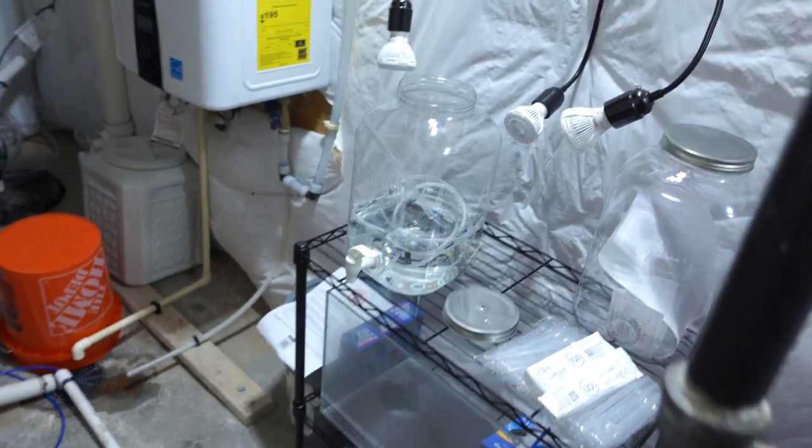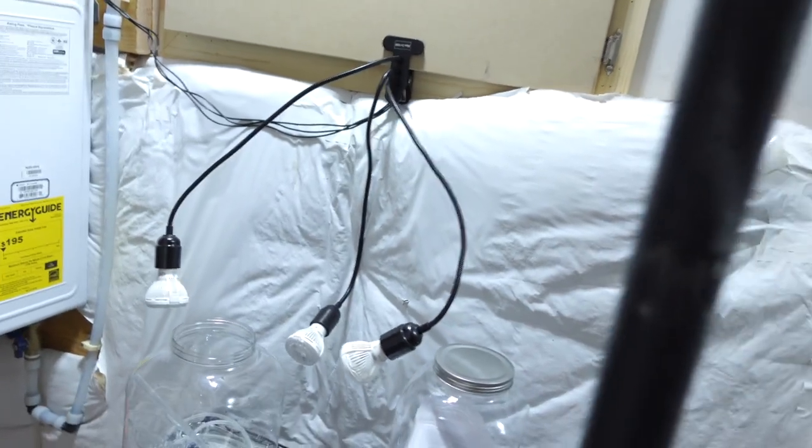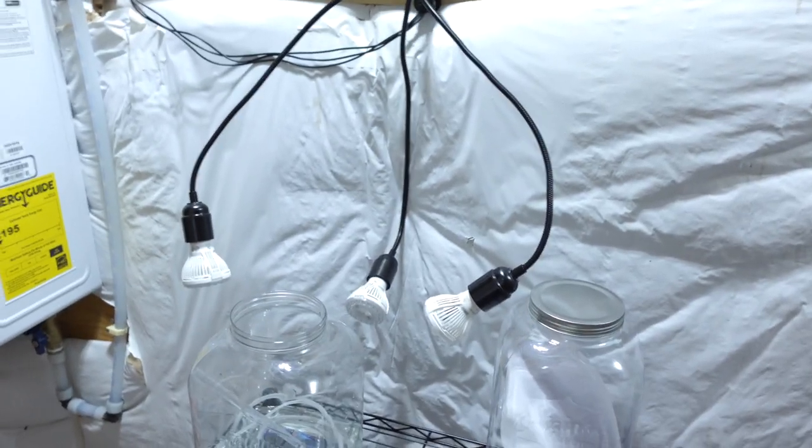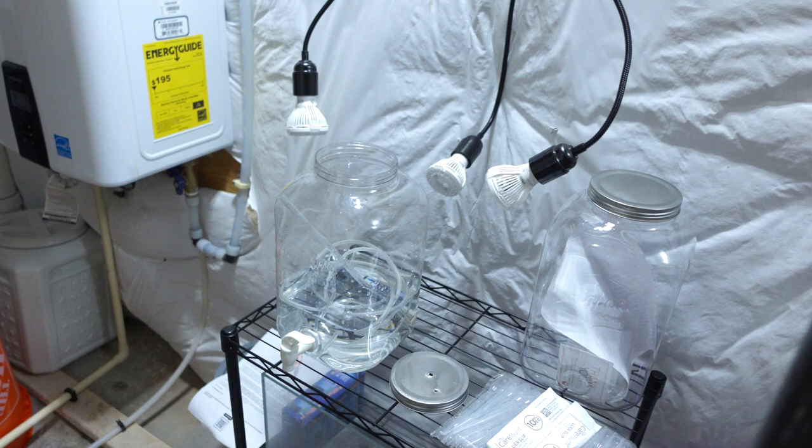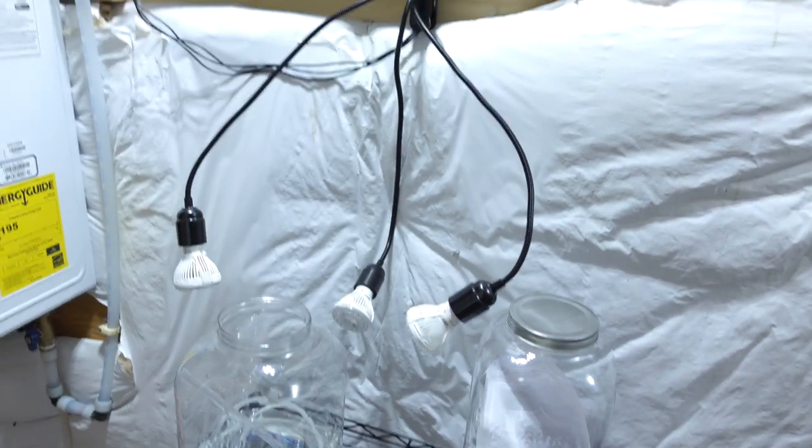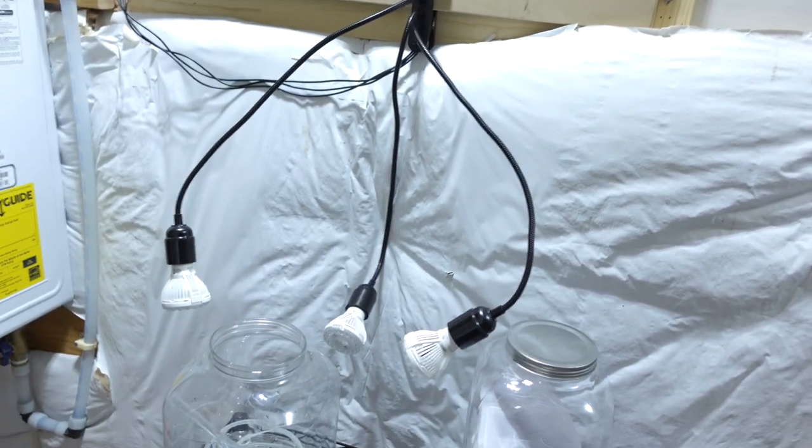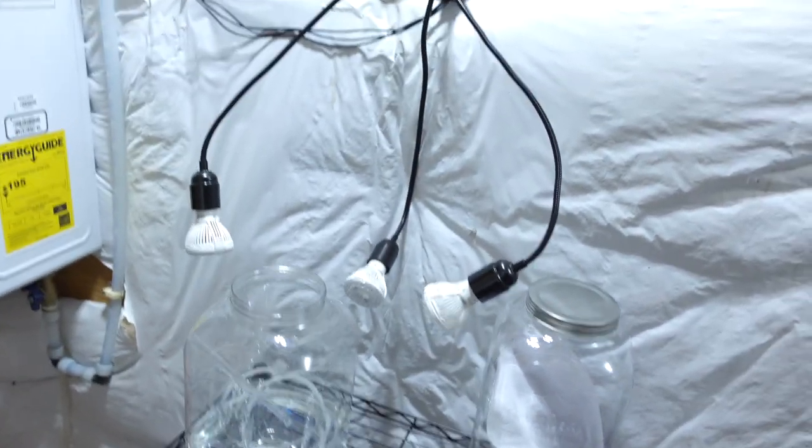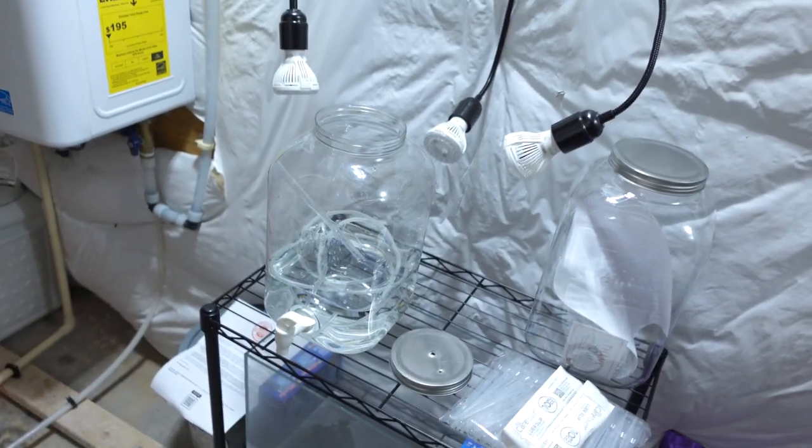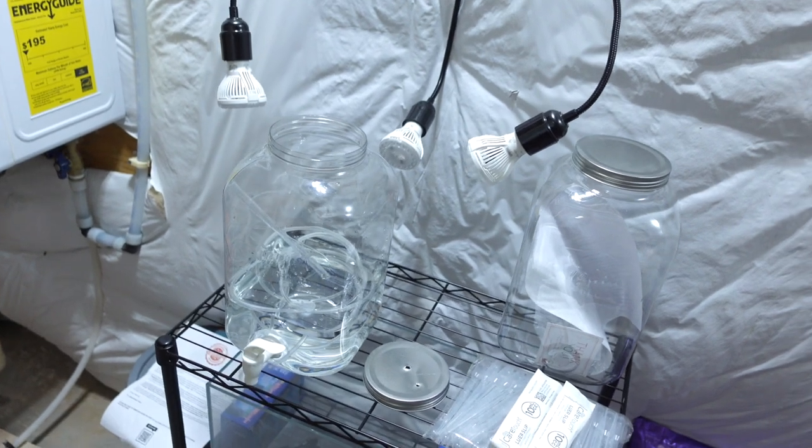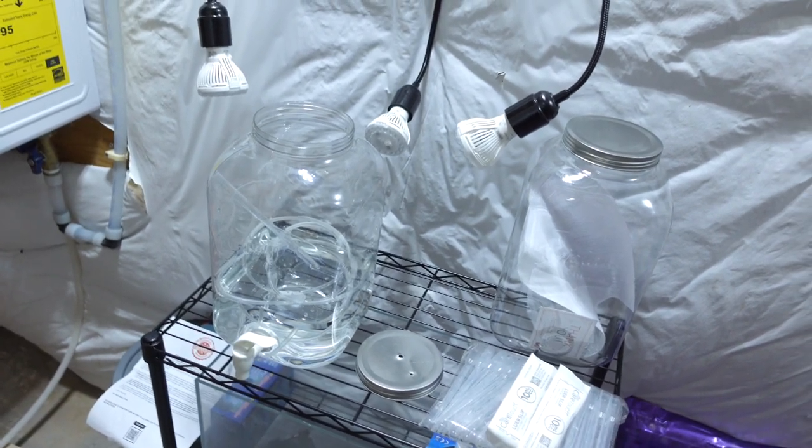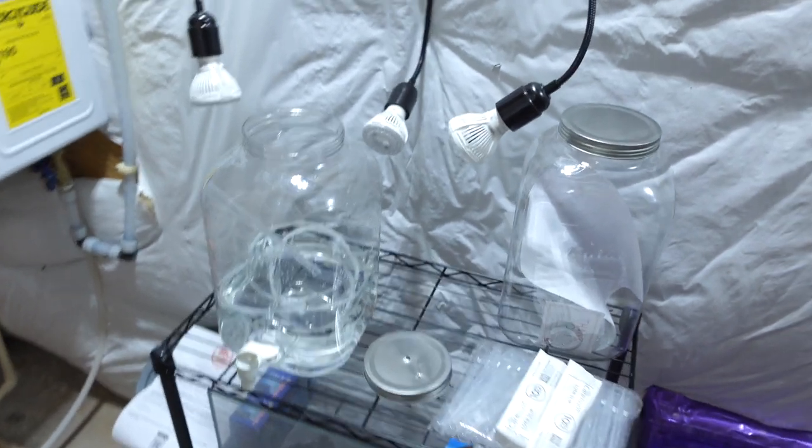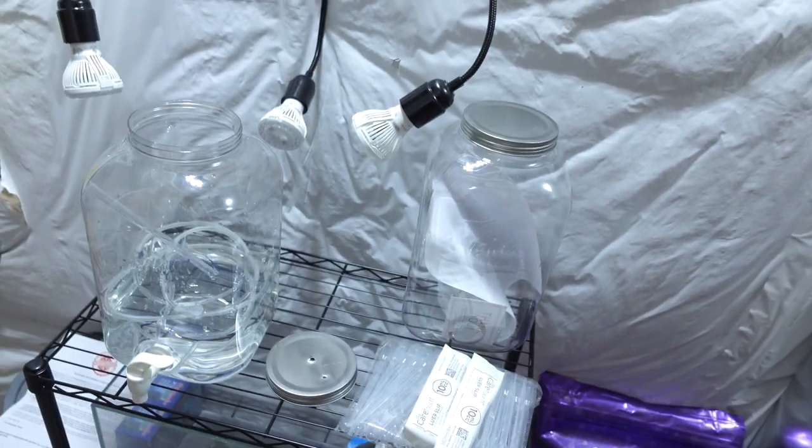So this is the setup here guys. This is like a grow light from Amazon. I attached it to this little crawl space door that I have. Should work. I'm going to put that light on a timer for 16 hours a day. And then I kind of like that it has those arms so that I can point the light at different parts of the actual container.